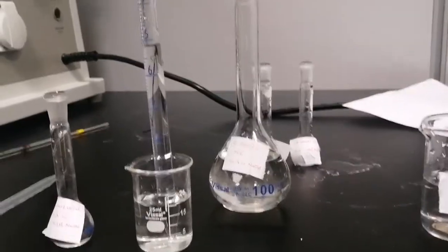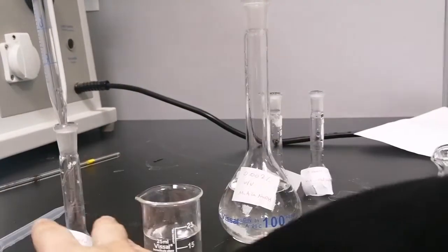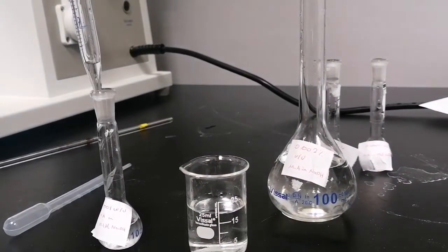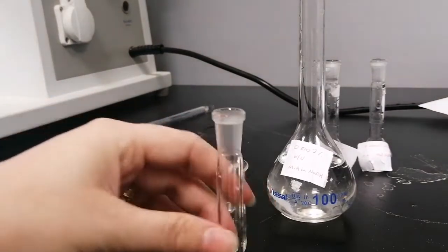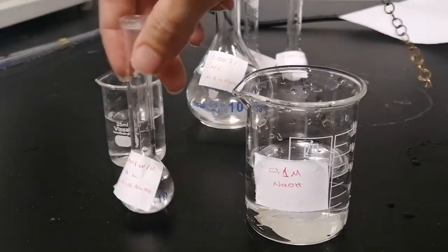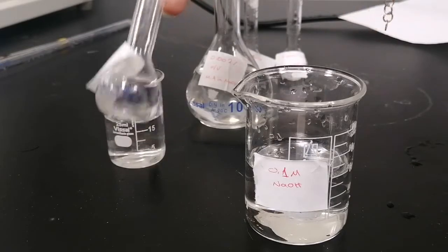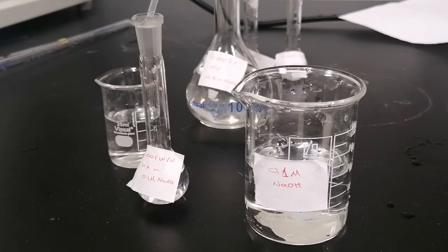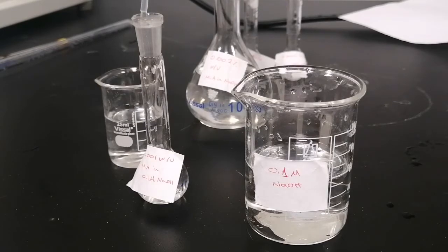using a graduated pipette. We will fill it to 5 ml. The last drop in the pipette won't be released, as an uncertainty. We will complete filling the 10 ml solution with 0.1 molar sodium hydroxide, and we must be careful as the 10 ml volumetric flask is very fragile and small in size, so we need to take care handling it. You fill it to the bottom of the meniscus at the line.